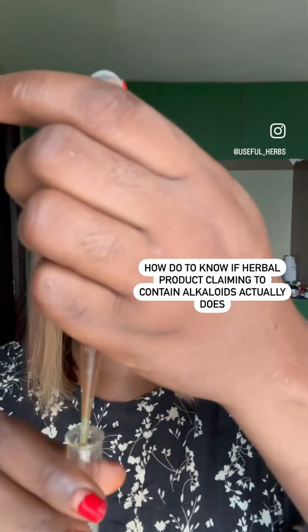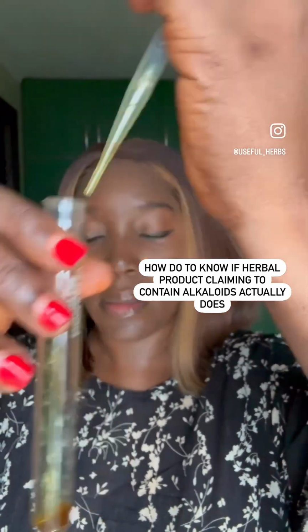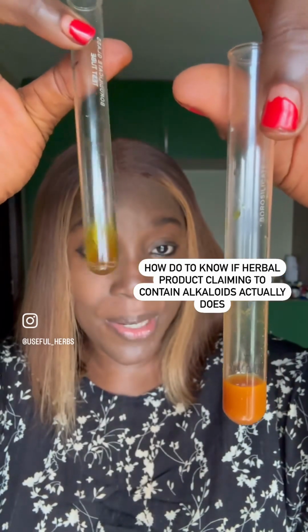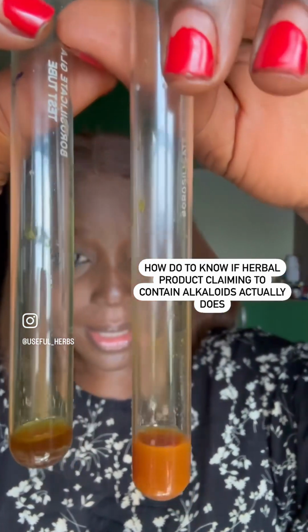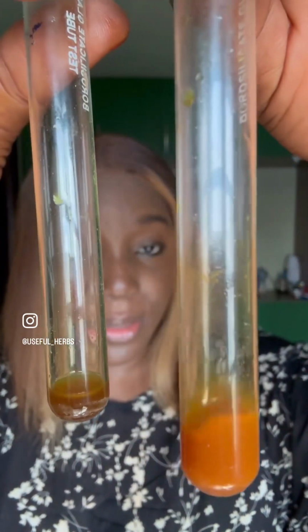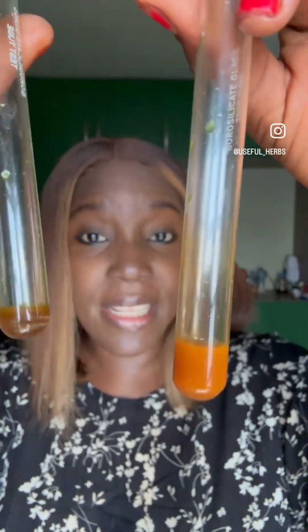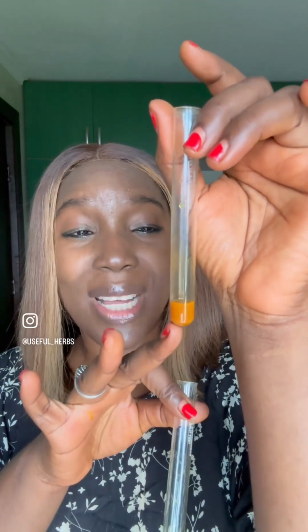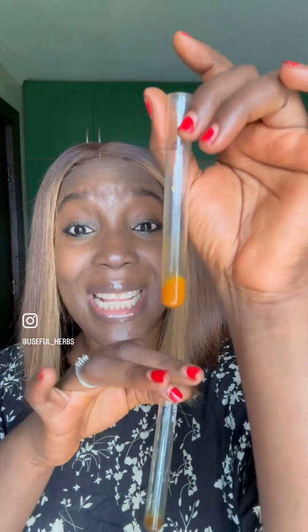So I'm putting it inside a clean one. Look at the difference. This is the protoberberine alkaloid, and this is the one that we added. It forms a brick red or bright orangish precipitate. Now if you leave it overnight to settle, you will see that the bright orange precipitate would have settled at the bottom, and what you have will be a clear liquid on top.